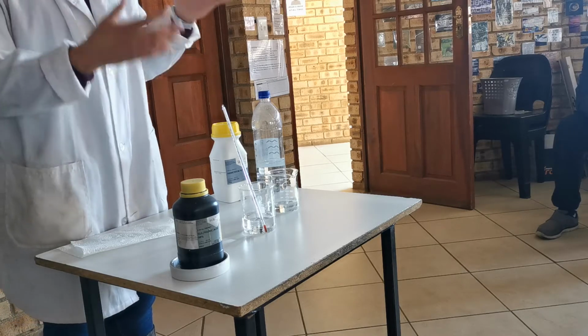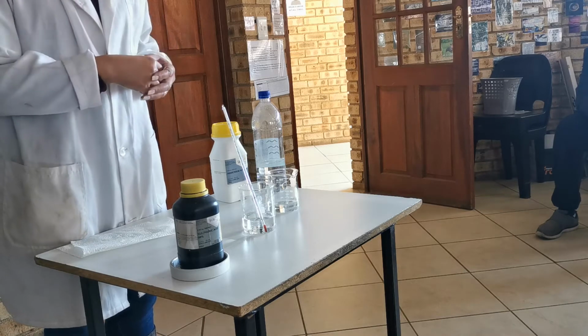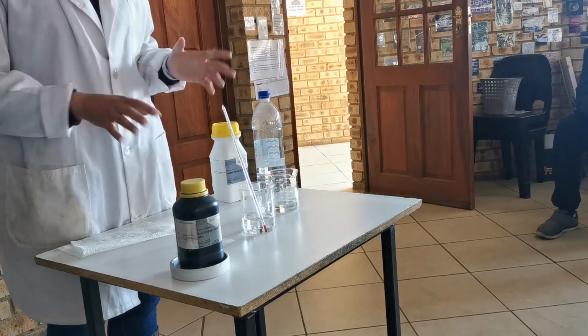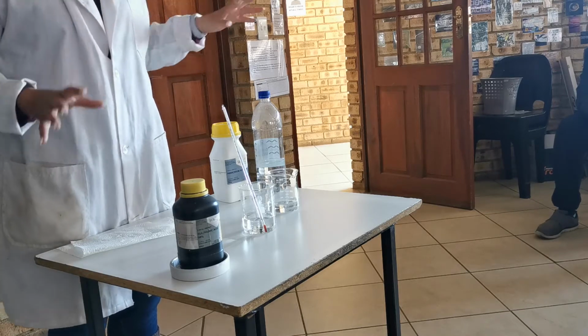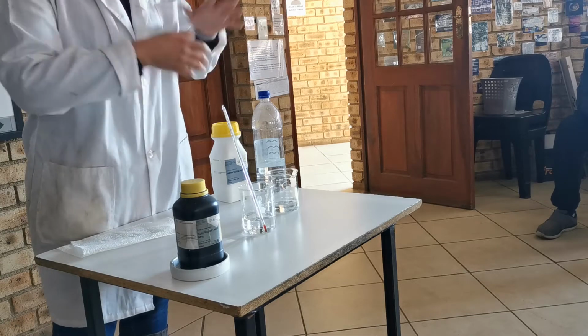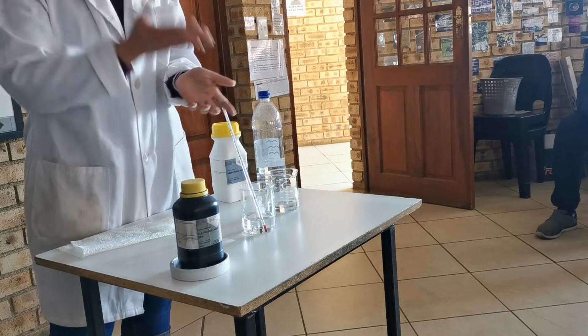The rule with acid is that if you get some on your hands, you rinse. That's the first thing. You rinse with water. So if we're ever in a lab situation where we're doing a prac and you spill acid or any chemical on yourself for that matter, the first rule is you rinse.